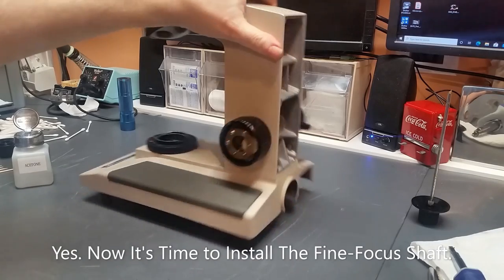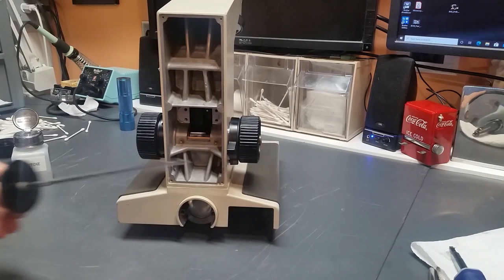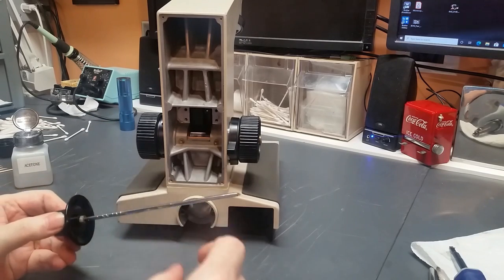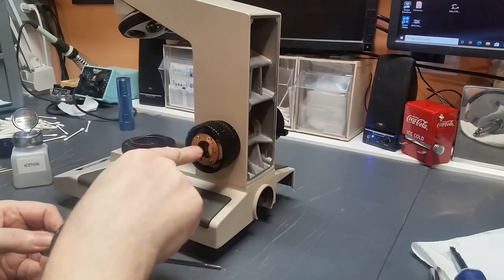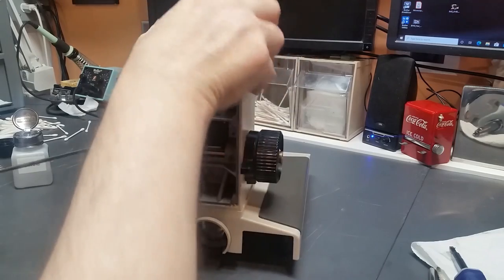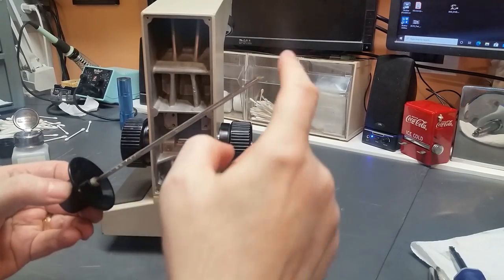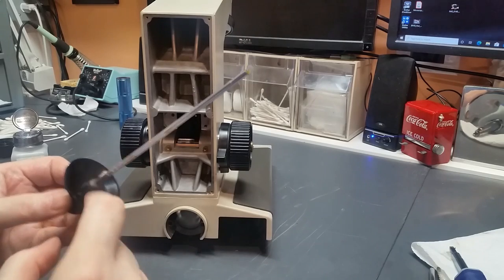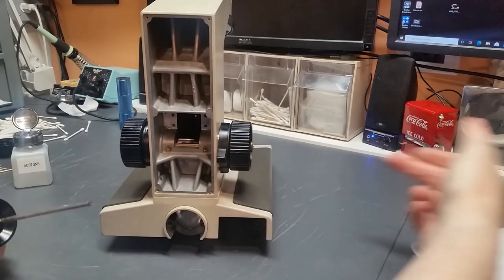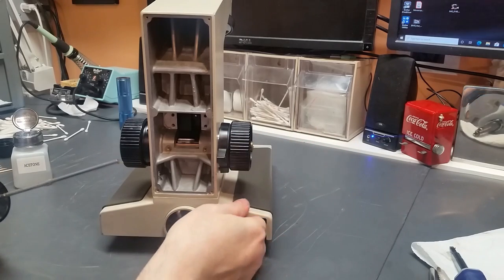Okay, the last thing to do is to put the focus knob, the focus shaft and fine focus knobs in. You will recall that this shaft is totally covered in grease. Also, this bore, both sides, there's grease distributed throughout that bore. So, depending on when you took it apart, if the fine focus shaft stayed on the knob with the gear, you'll have to put it in through this side. If, on the other hand, it stayed with the other one, you'll have to put it in from that side. That's pretty obvious, but I suppose it's worth saying.